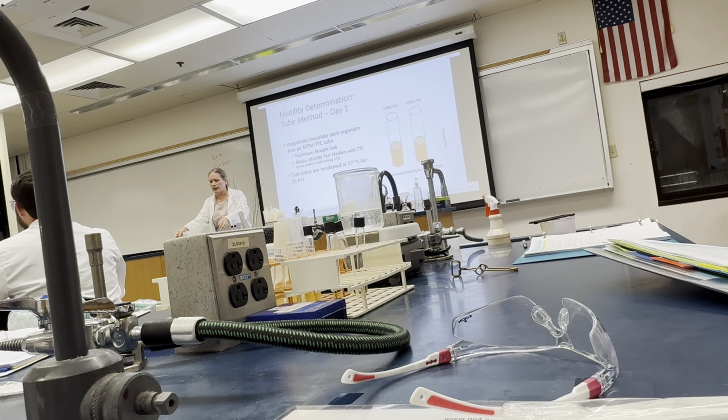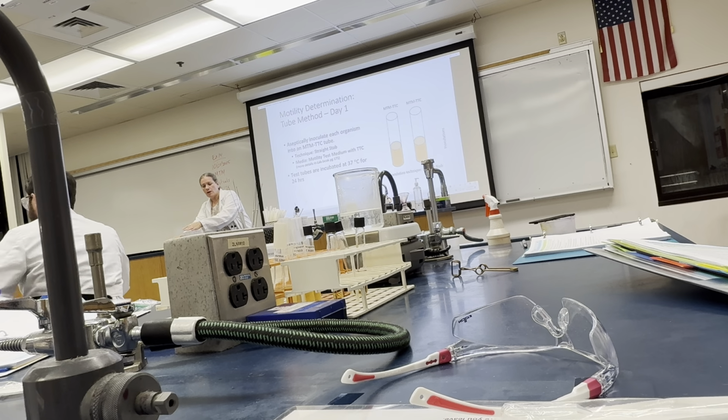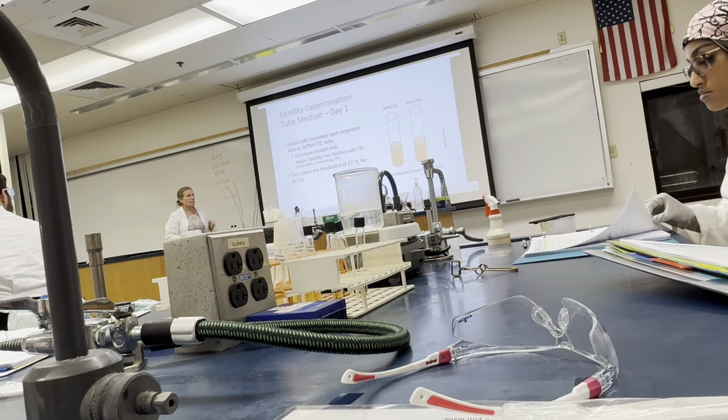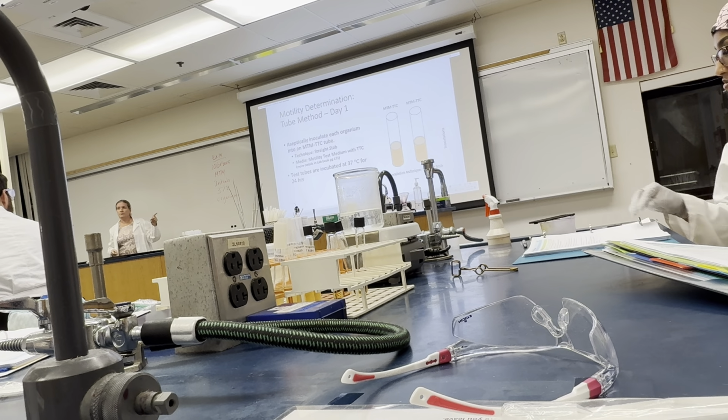You'll go on to the rack up here. There is a white rack sitting by each of the originals. Put it in the white rack sitting next to the same media, because these actually come out a little later than the FTM. The FTMs come out sooner. That's why we have to keep the rack separate and the media separate. All right, any questions in regards to this?